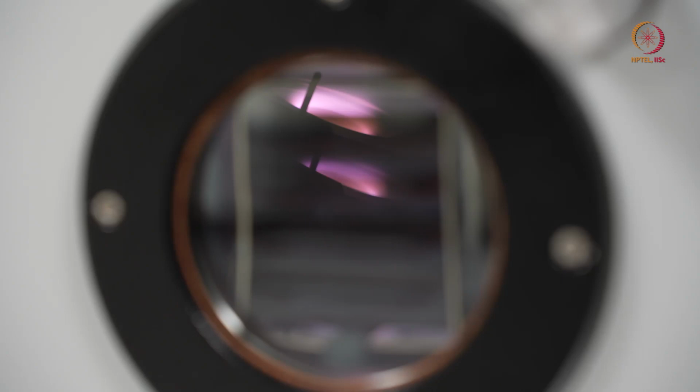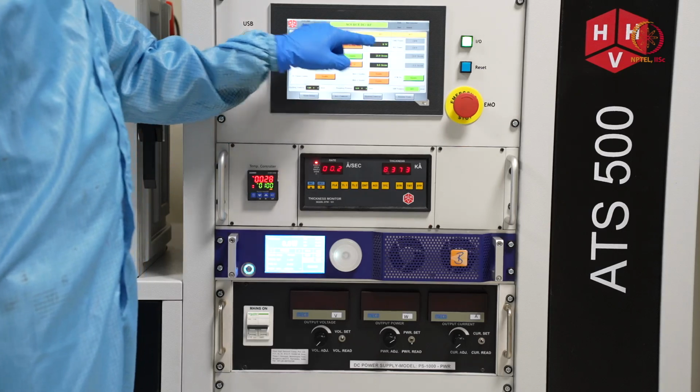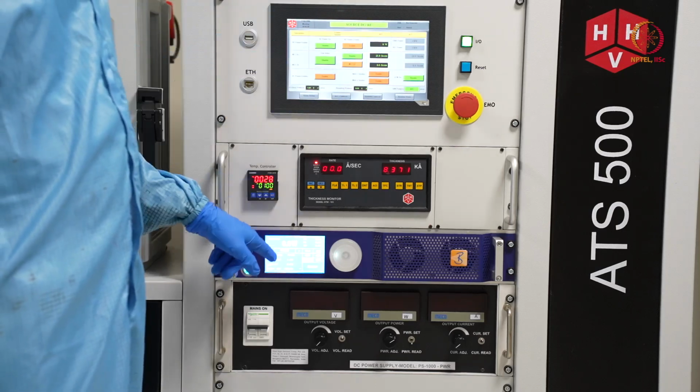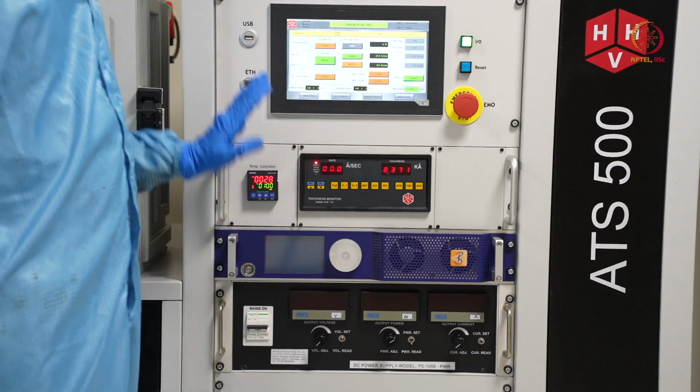Actually speaking, we should deposit for at least 15 to 20 minutes, but here, as you can see, just 3 to 4 minutes are there. So it will be just a very thin layer, but still we will show you that only. As you can see, we set it at 0 watt, so now it is 0. Now we can switch it off. So this part is done.